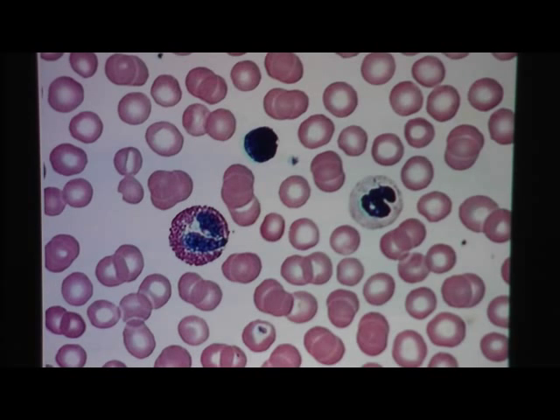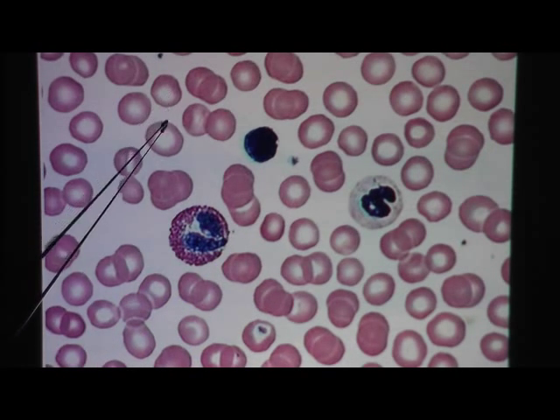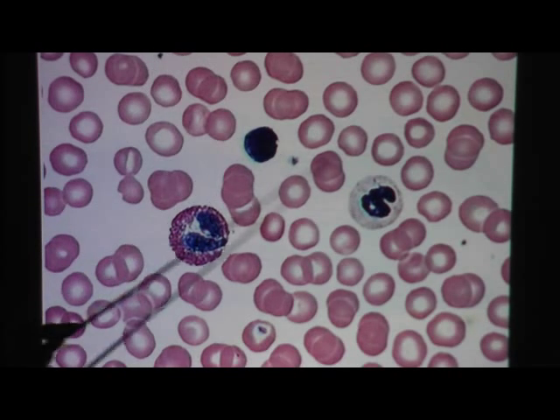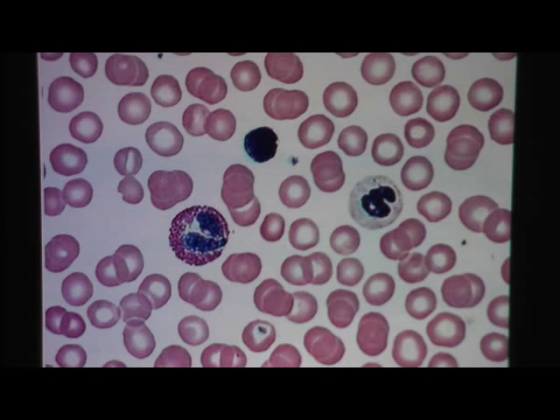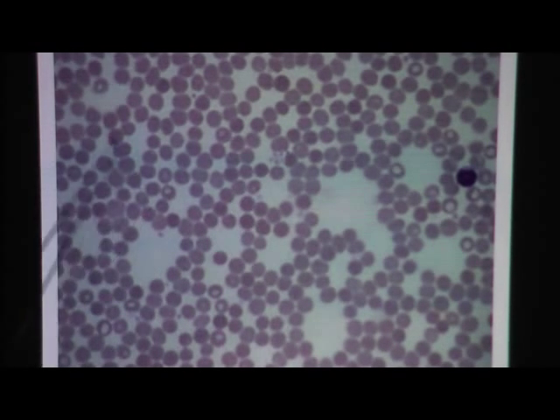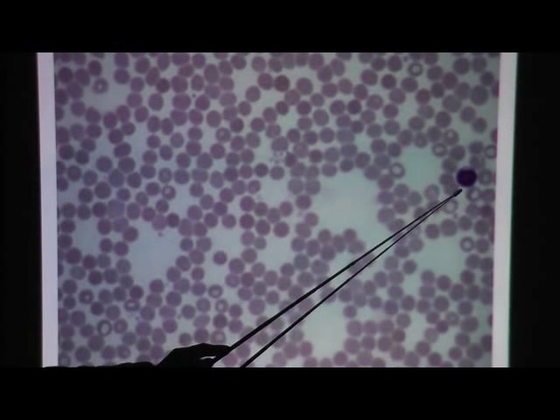Here's another blood picture. White blood cells here, white blood cells there. All of these are red blood cells, and then we have a couple of platelets. The rest of this is plasma. On medium power, you see a lot of red blood cells and one white blood cell. I'm sorry — I didn't mean to say platelets, this is plasma. That's not platelets, that's plasma.